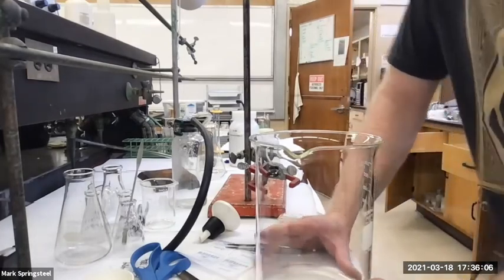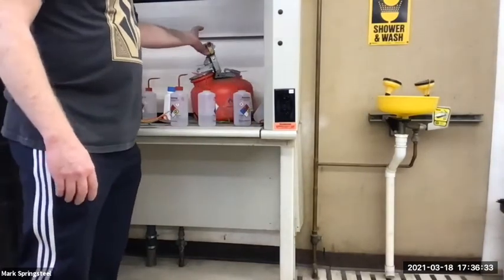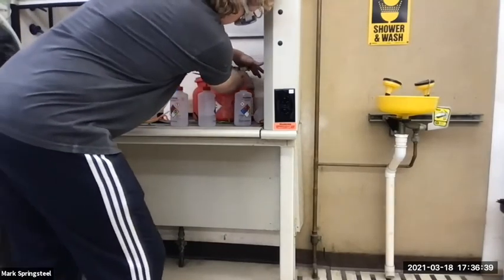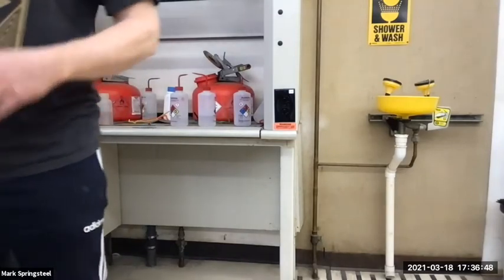And the waste container, I'll show you, it's over here. You just throw everything that can't go down the sink into it, right? It's changed over the years. We used to have an aqueous waste container, an organic halogenated waste container, and then an organic non-halogenated waste container, like molecules with halogens or not. We'd segregate it into 3, and then solid waste. But now they've just decided people aren't good at sorting them anyways, so they just have us put the aqueous and the organic both in here, and then the company that takes it away and properly disposes of it, they separate it out.